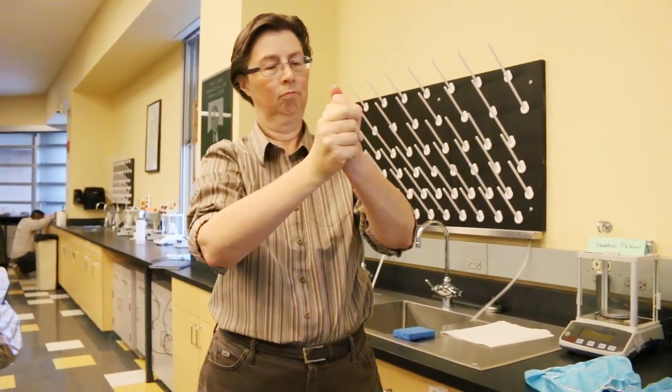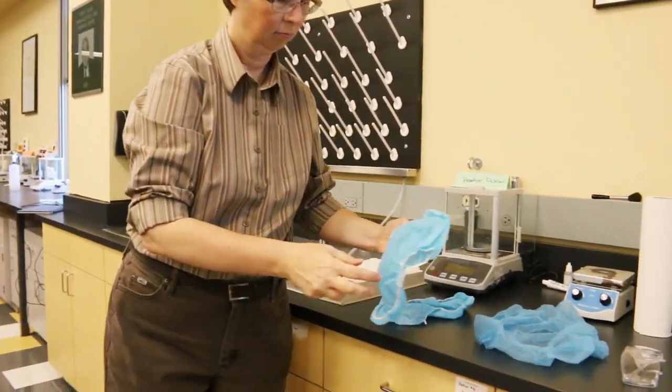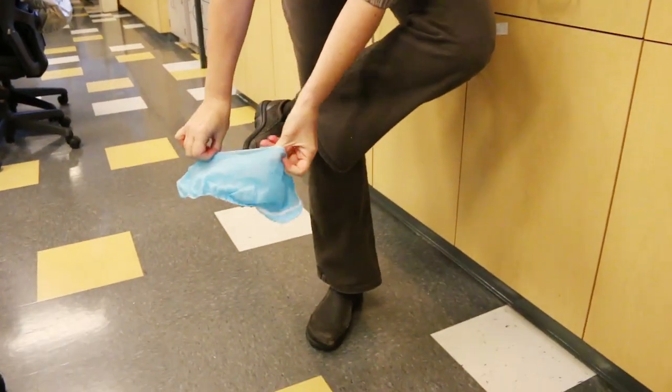Step 4 is to don shoe covers, one at a time, being sure to completely cover each shoe.